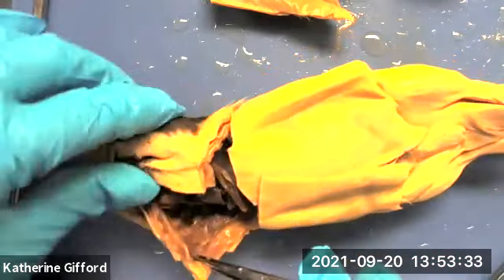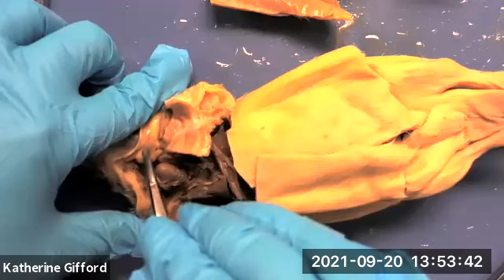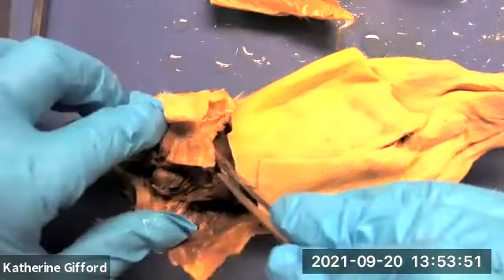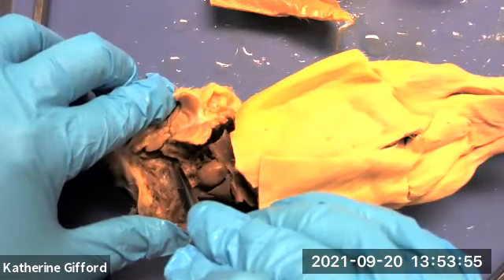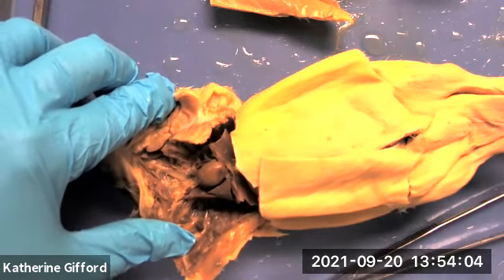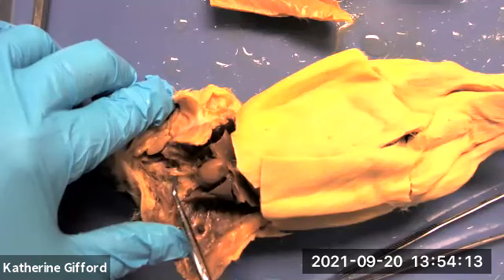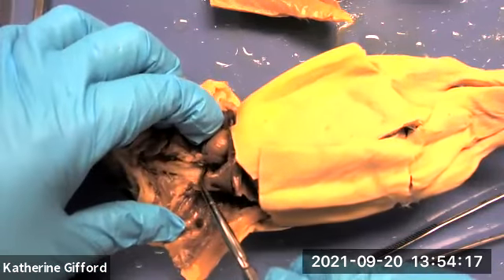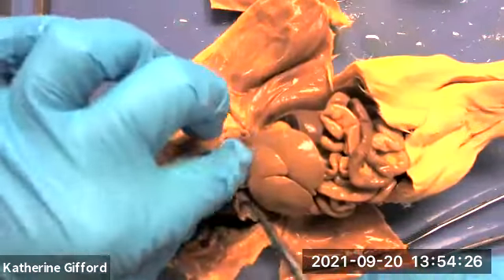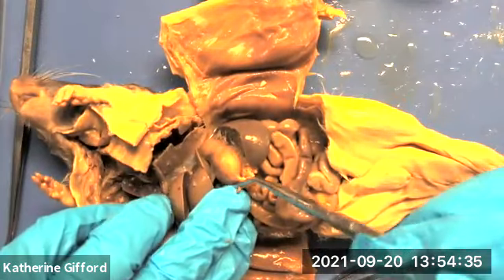When we look in the neck, there's this large submandibular gland that's visible. We move the heart out of the way. The trachea is right next to the esophagus. The esophagus is going to go through that thoracic cavity, passing through the diaphragm.